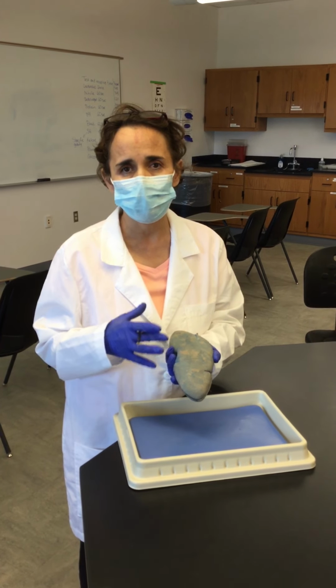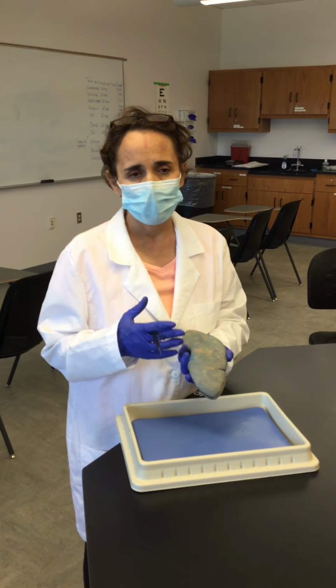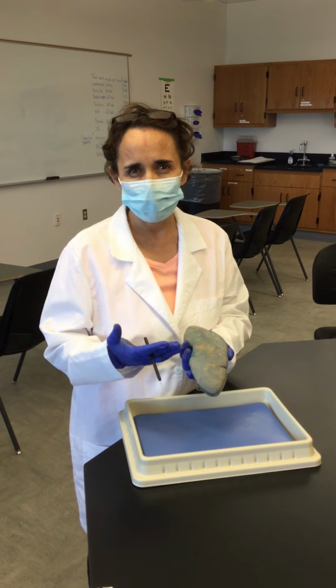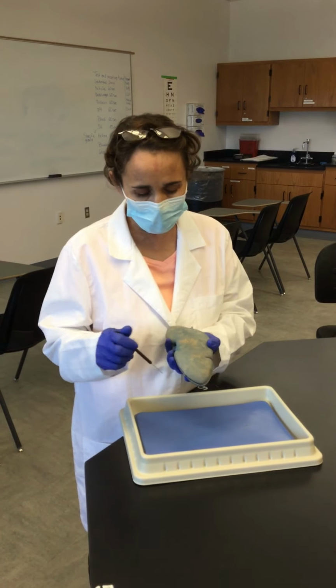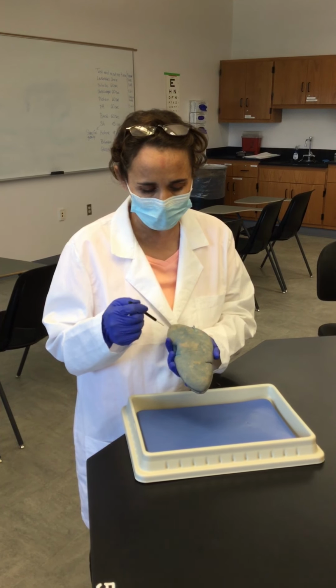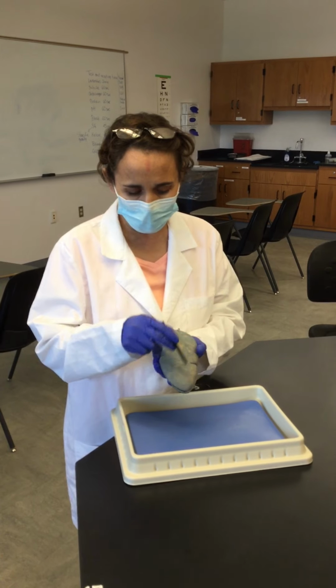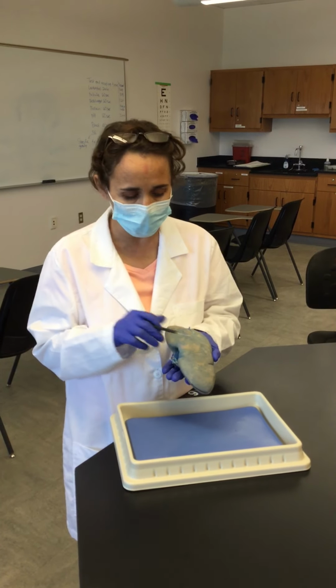and also helps to keep the kidneys in their place, which in the case of humans will be around the level of L1 to L3 or so. And the kidneys have a pinto bean shape like this, and they have the convexity facing laterally while the concavity faces medially.